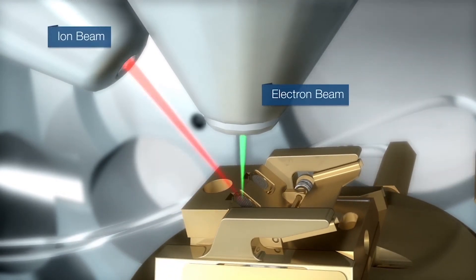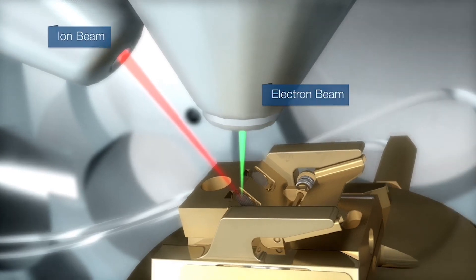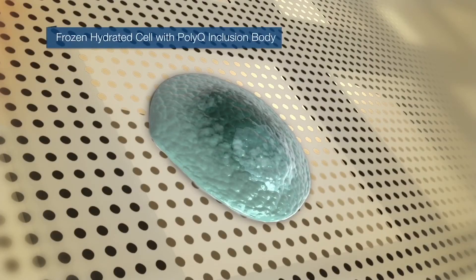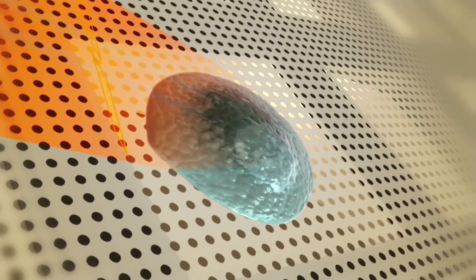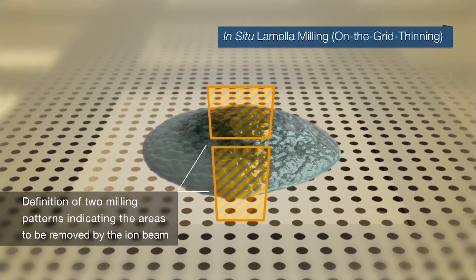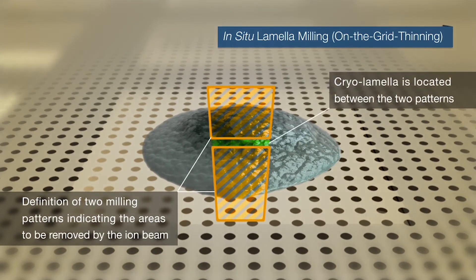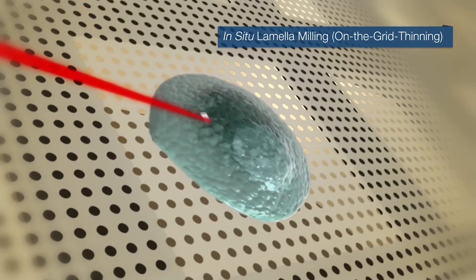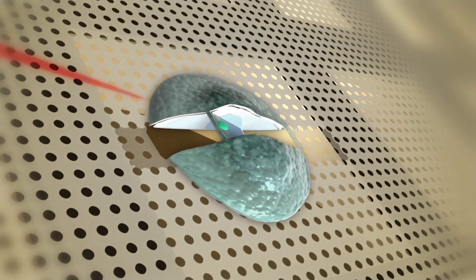We use the electron beam to locate the cell of interest by correlative microscopy. Finally, we use the ion beam to ablate large parts of the cell, resulting in a thin lamella containing a section of the polyQ aggregate within its pristinely preserved cellular context. This is what we call an in-situ study of protein aggregates.